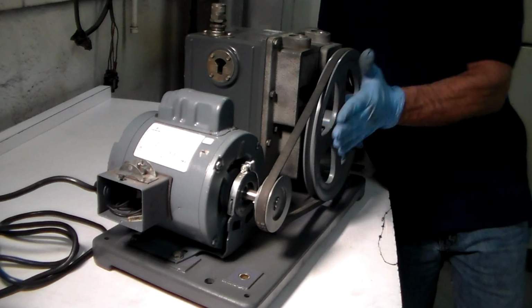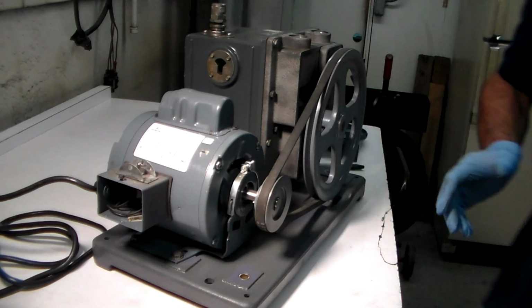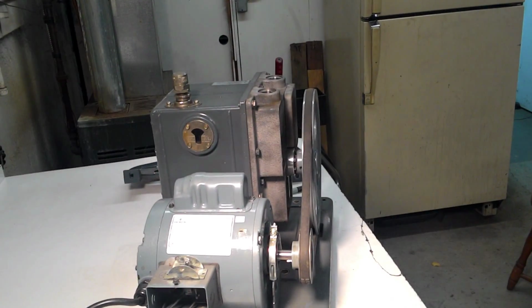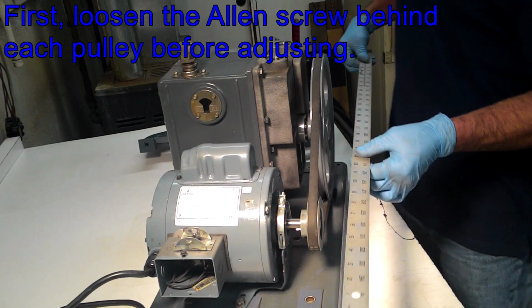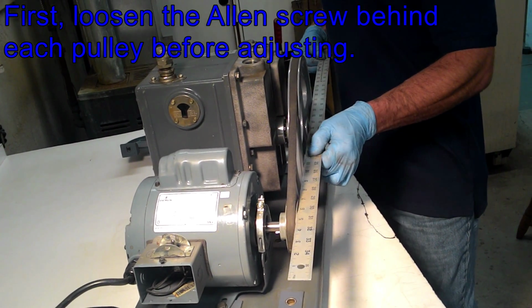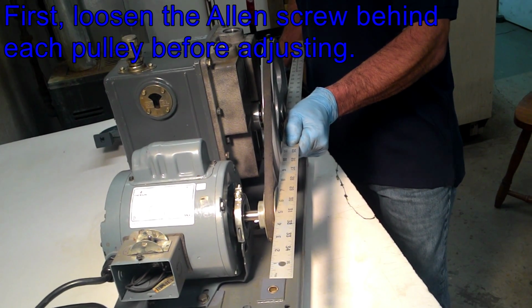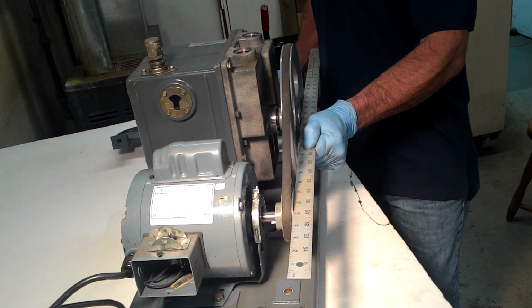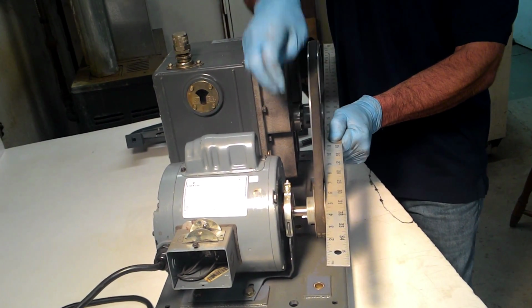Now, there is also an alignment. This pulley needs to be aligned with this pulley. It's very simple. You take a straight edge. Here's a big straight edge that I have that I use on all the pumps. You put it on the pulley and you put it on the other pulley, and they should line up perfect. That's how you get your alignment from pulley to pulley, so that these grooves are perfectly in line so it doesn't eat up your belt.